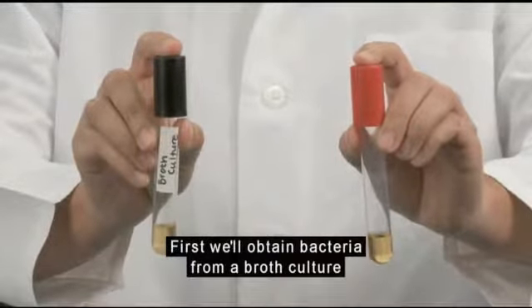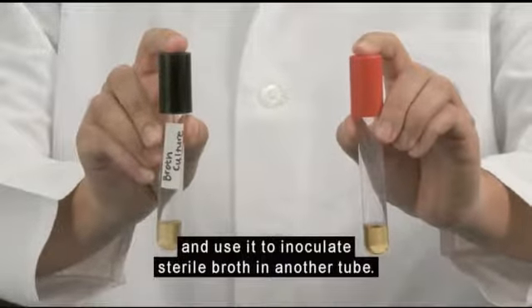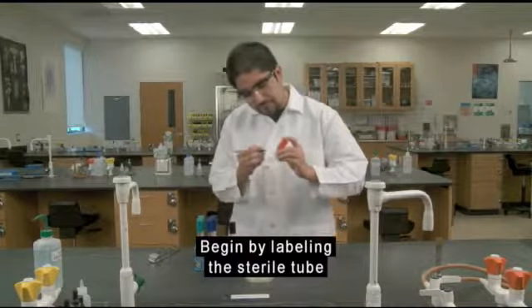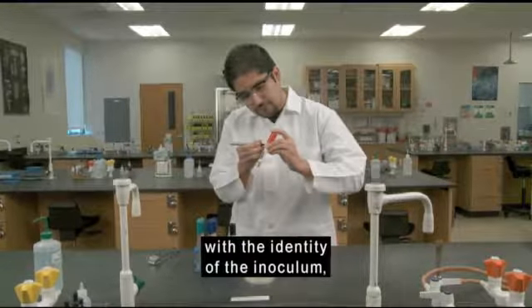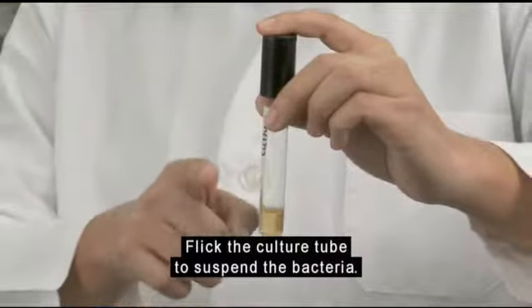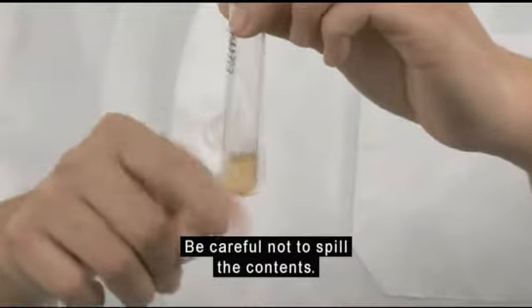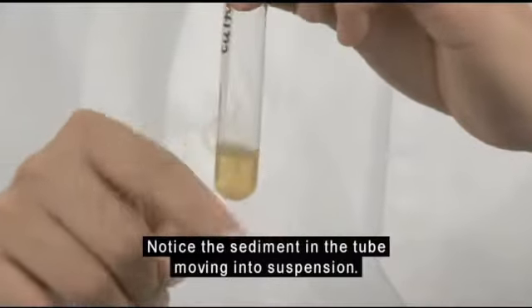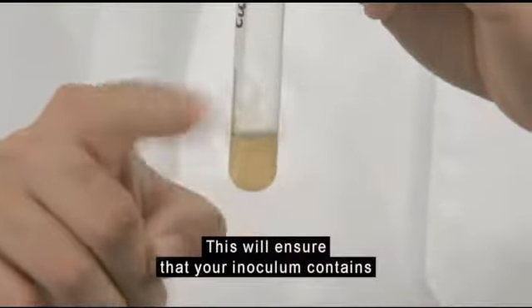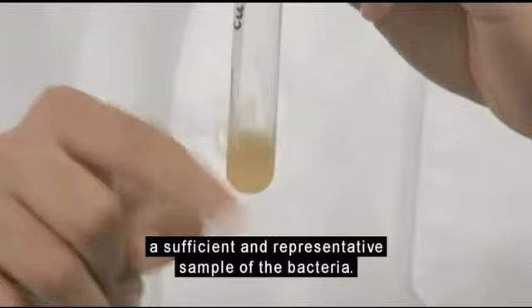First, we'll obtain bacteria from a broth culture and use it to inoculate sterile broth in another tube. Begin by labeling the sterile tube with the identity of the inoculum, your name, and the date. Flick the culture tube to suspend the bacteria. Be careful not to spill the contents. Notice the sediment in the tube moving into suspension. This will ensure that your inoculum contains a sufficient and representative sample of the bacteria.